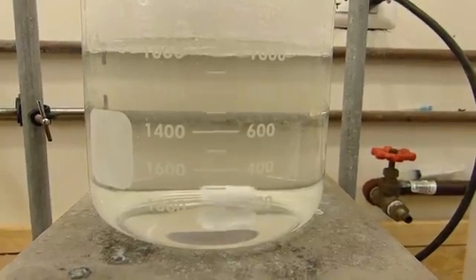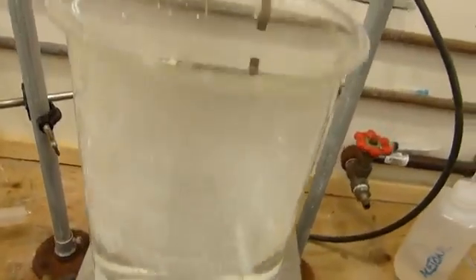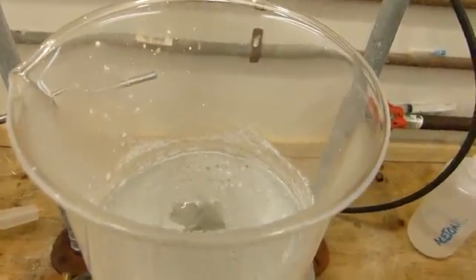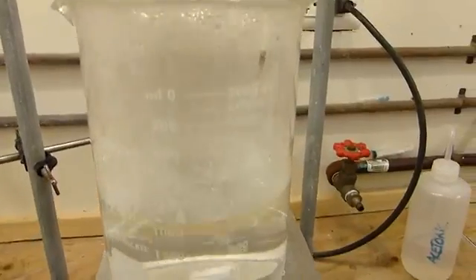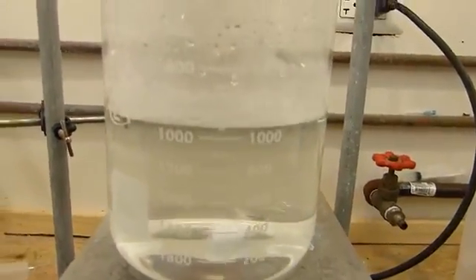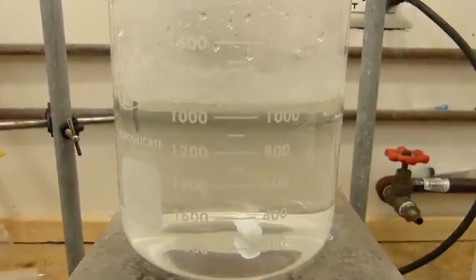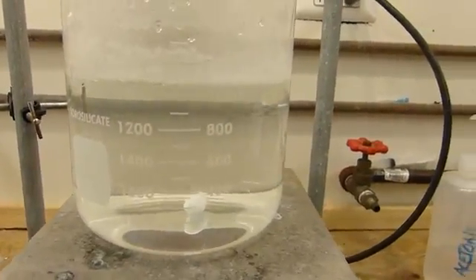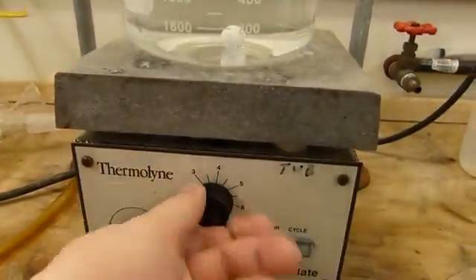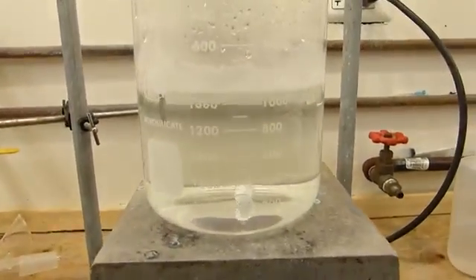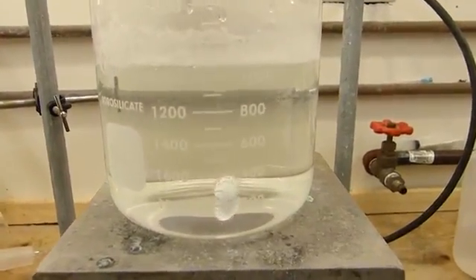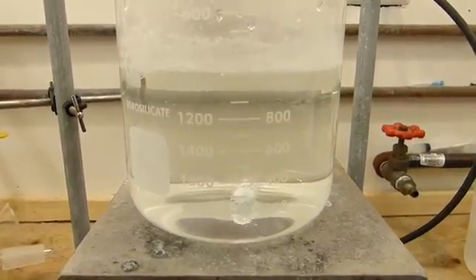All right. Well, all the benzoic acid appears to have dissolved, except for this little crust on top, which just forms no matter what you do when you have saturated solutions at high temperatures like this. So I can go ahead and turn off the stirring and use a magnet to retrieve my stir bar. And then I'm going to go ahead and let this cool down. Turn this off. Let this cool down and the benzoic acid should crystallize. And then we can collect the newly purified benzoic acid.